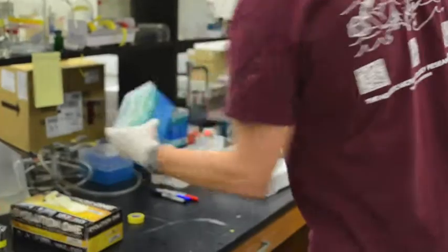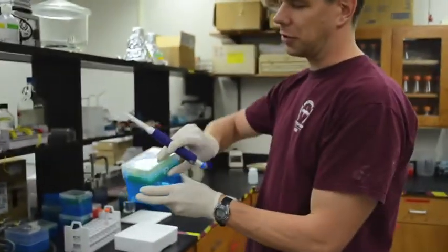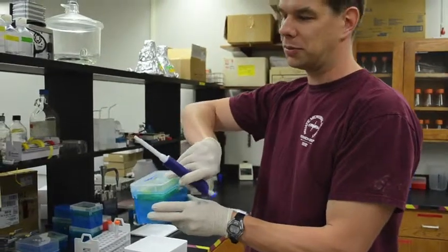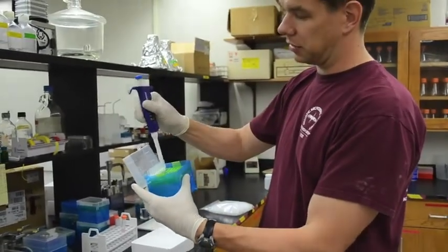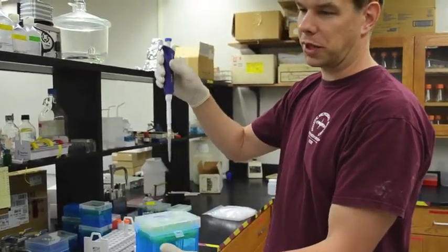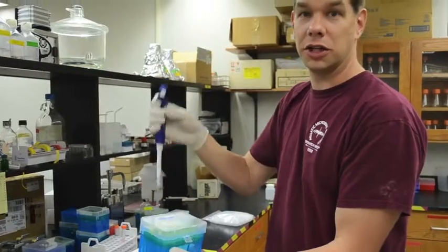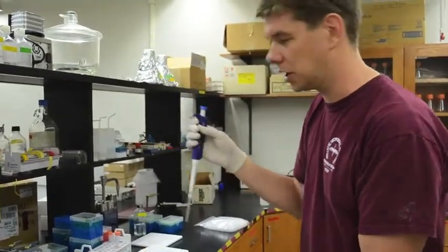And I'm going to take my pipette box. You don't want to get any dirt in the pipette, in the box of pipette tips, so we always just open it up, take out a pipette tip, and close it up. And notice that when I took out the pipette tip, I didn't jam it on real hard. There's no need to do that. I just sort of put it on gently, just enough force that it'll stay on.